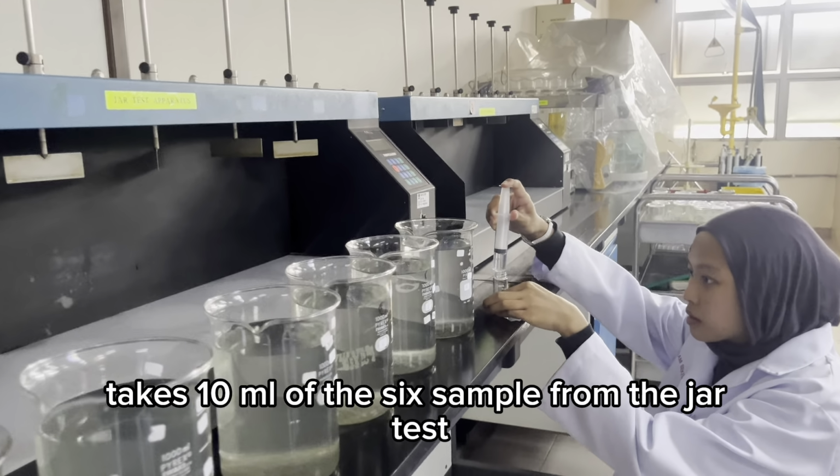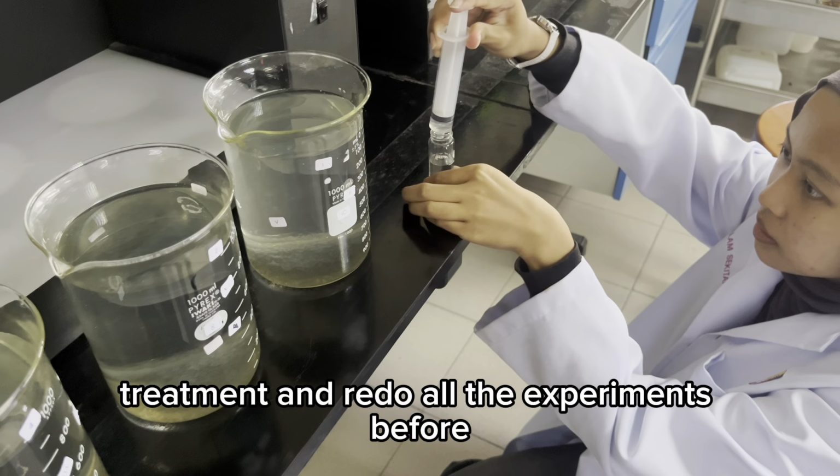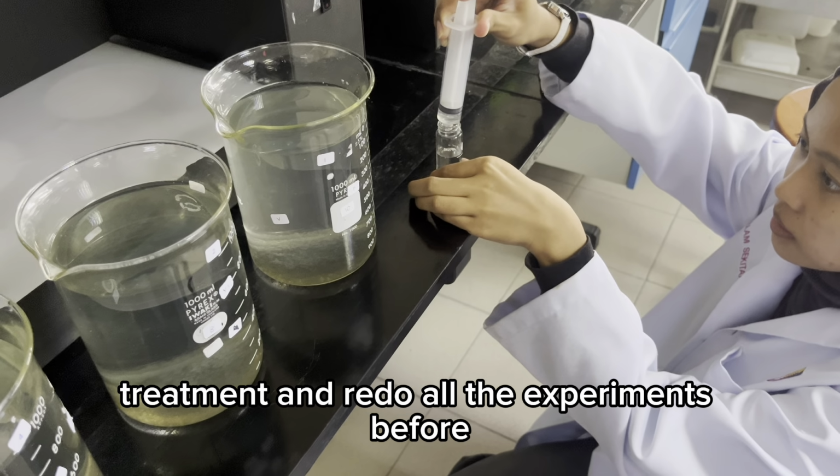Take 10 ml of each of the 6 samples from the jar test treatment and redo all the experiments from before.